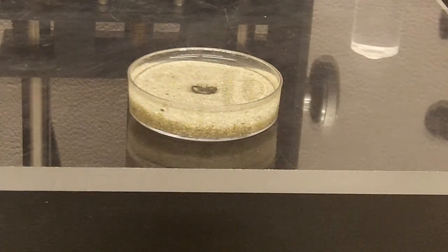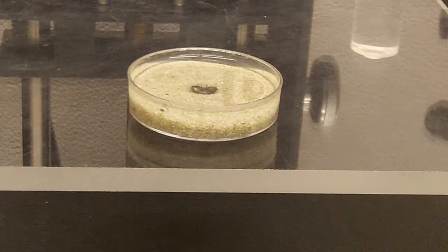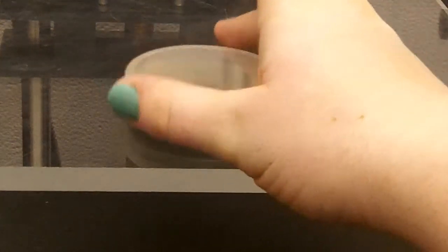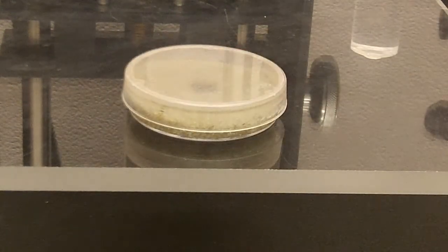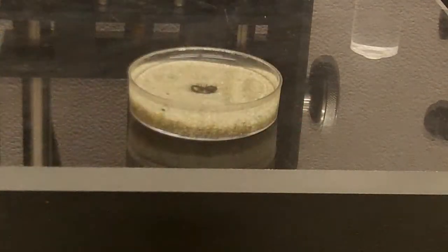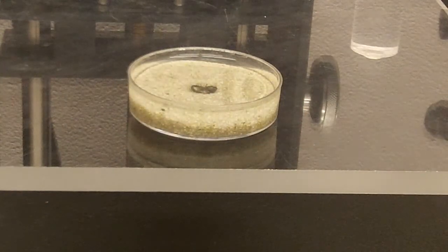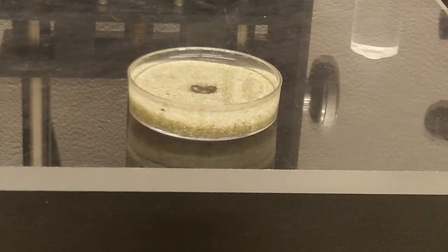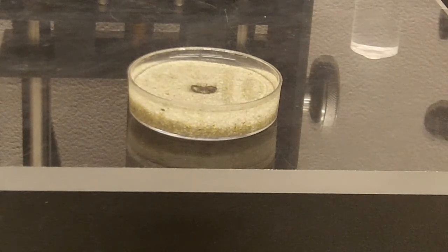And another thing I like to do, if I have an extended period of time, you can put a cap on the petri dish, which will prevent a lot of evaporation. So it just saves you time from having to constantly add more ethanol to keep the specimen completely covered.